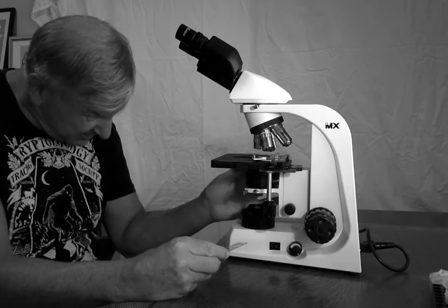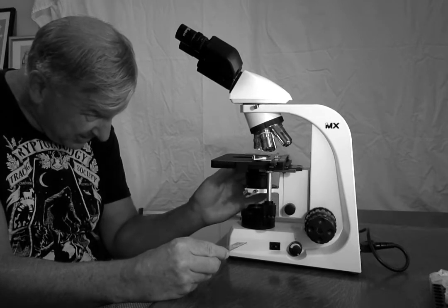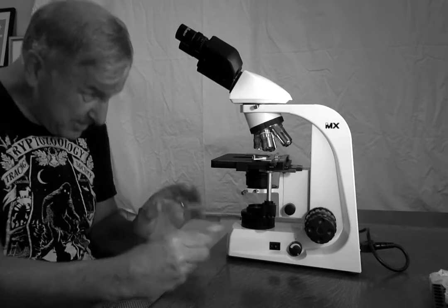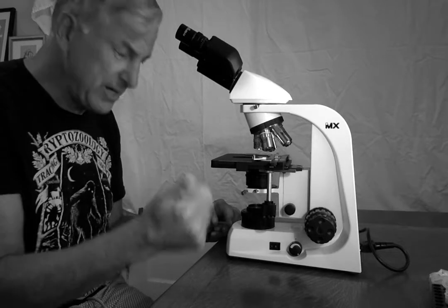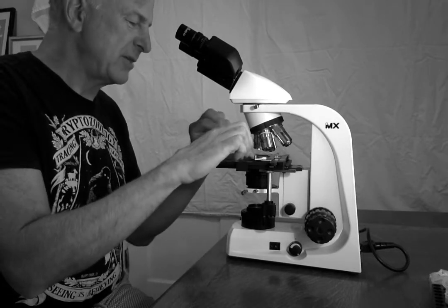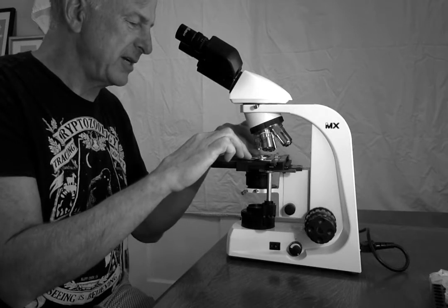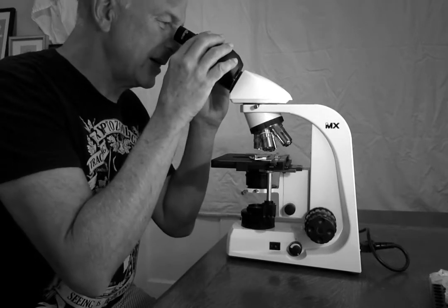So I'm going to open that. To the left is pretty much closed, to the right is wide open. I'm going to put it at what I estimate about 75%. There's a little dot here, so I'm three-quarters of the way to the right. It looks pretty bright, and that's going to be my starting point. Now I'm going to return my slide. And here we go. All right.